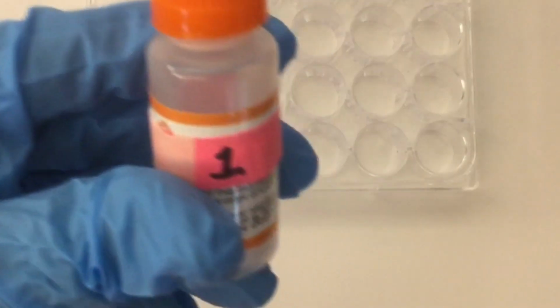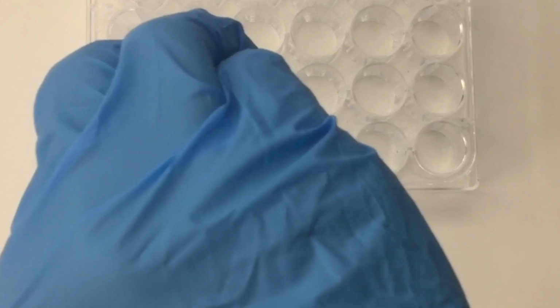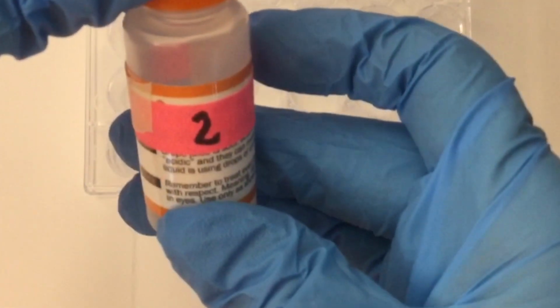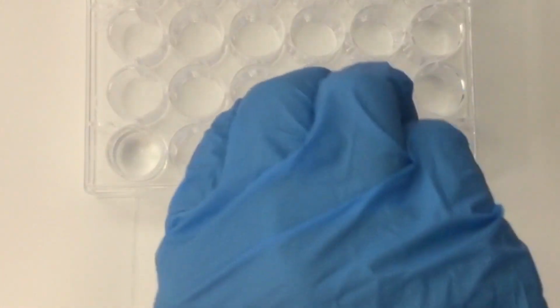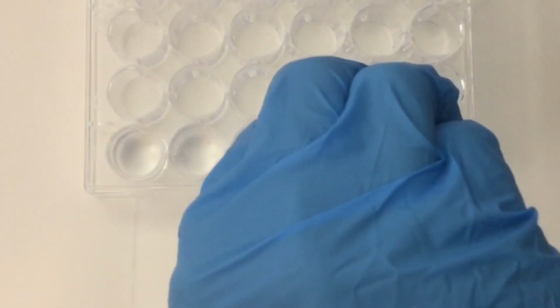So here we go for Part 1. You know what the 6 common household liquids are: baking soda, diluted ammonia, grape juice, lemon juice, saline solution, and regular water. But what you don't know is what order I am going to test them in the video here. As you can see, my bottles are numbered 1 through 6, but I have them covered up so you don't know what they are. And what I'm doing is I'm filling each well up about halfway with each liquid. After I get them filled, then we'll move on to the pH indicator.